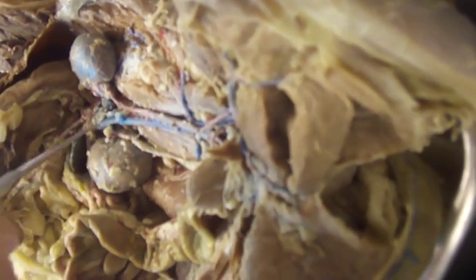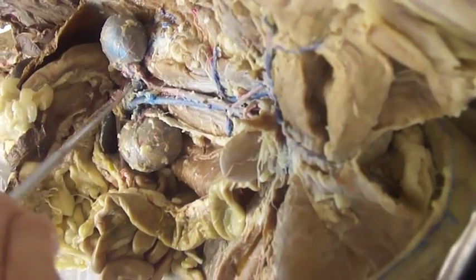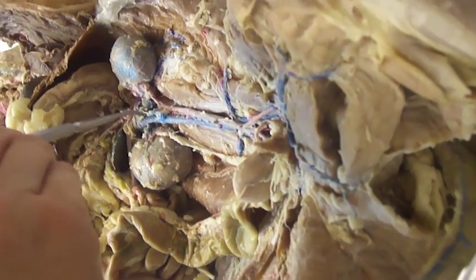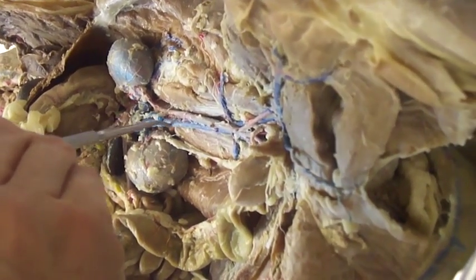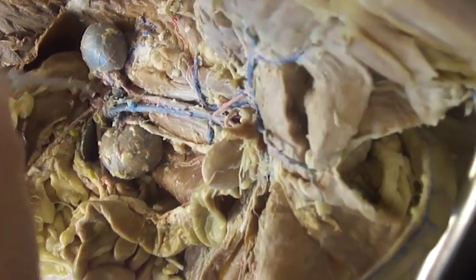Continuing down the abdominal aorta, you can see both the left and somewhat right renal arteries paired with the renal veins, which are branching back towards the inferior vena cava — this large blue vessel here.